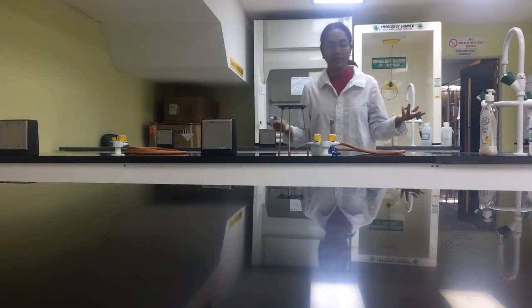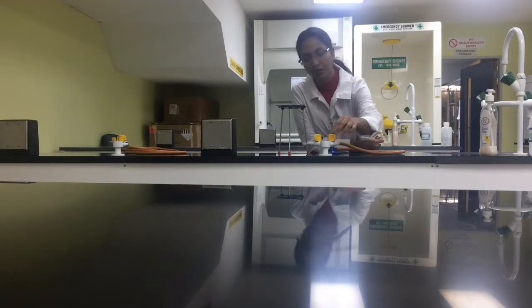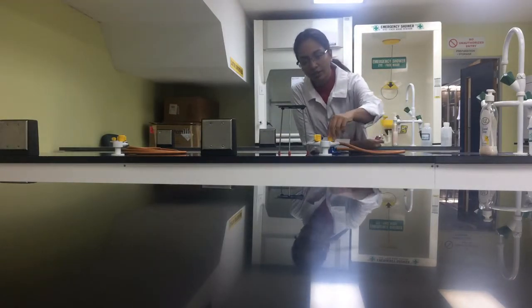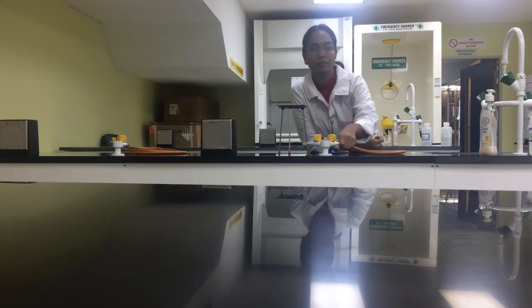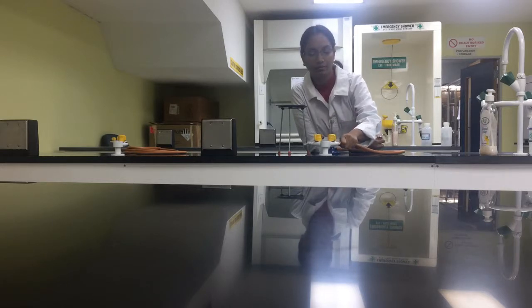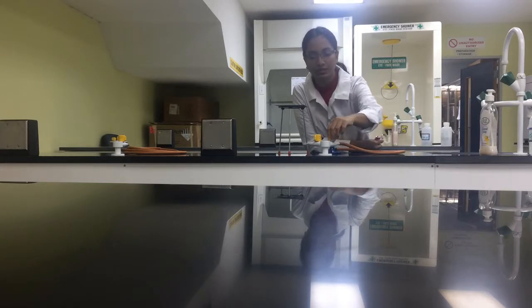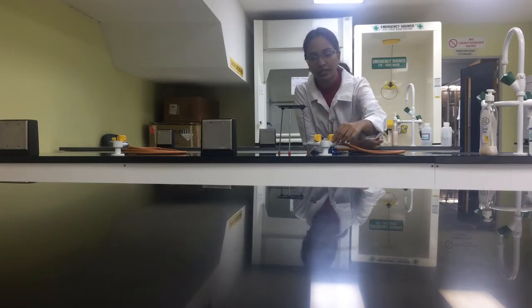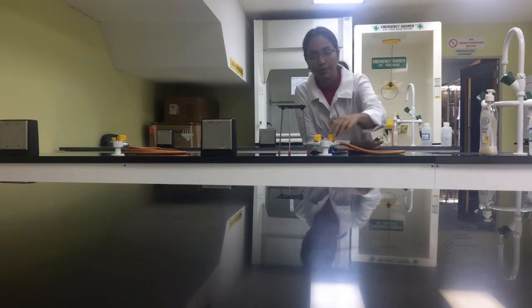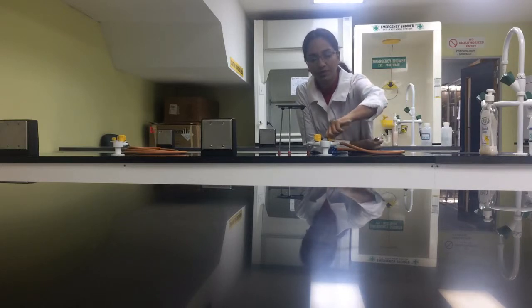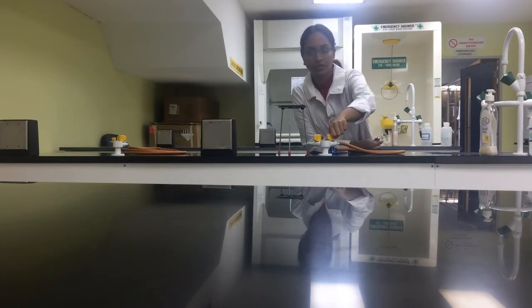So, the next step is basically to lift the lever. Your levers may be made differently, so look at the instructions. But for ours, in this lab, in the school lab, you lift and you turn.